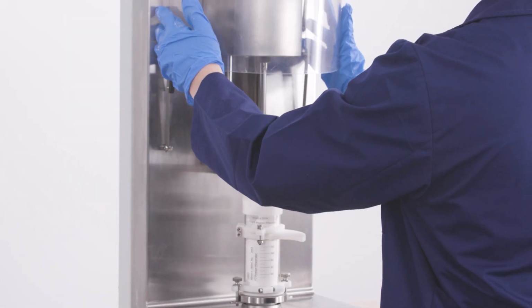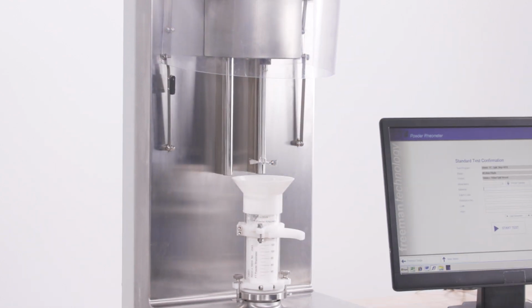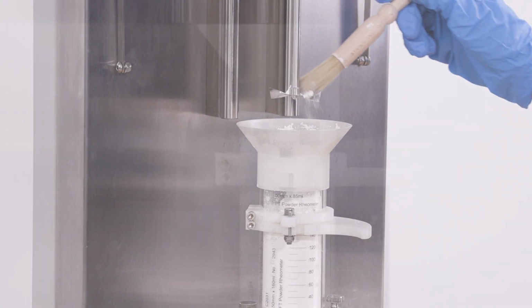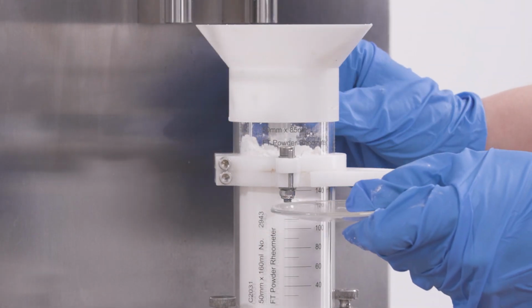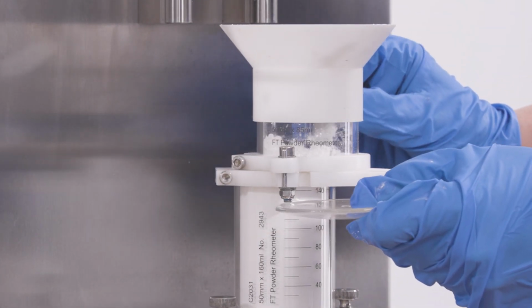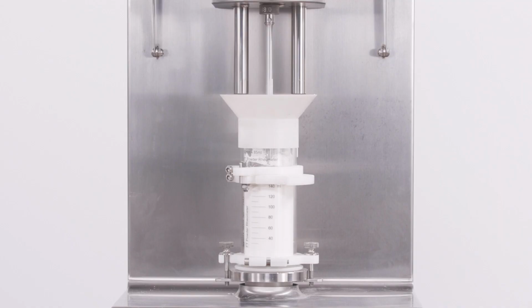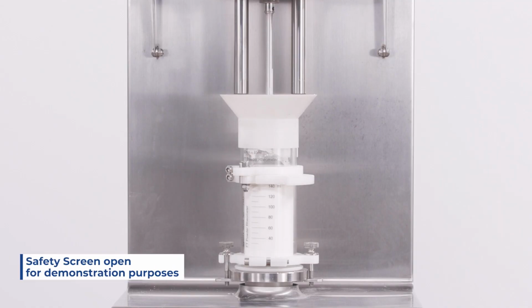Now that the initial conditioning cycle is complete, I will open the safety shield and brush off any excess powder that was stuck onto the blade before splitting the top half of the vessel open, removing any excess powder. I've now isolated a 160ml powder sample. I will then return the vessel back to its closed position and close the safety shield before clicking OK to continue with the rest of the test.